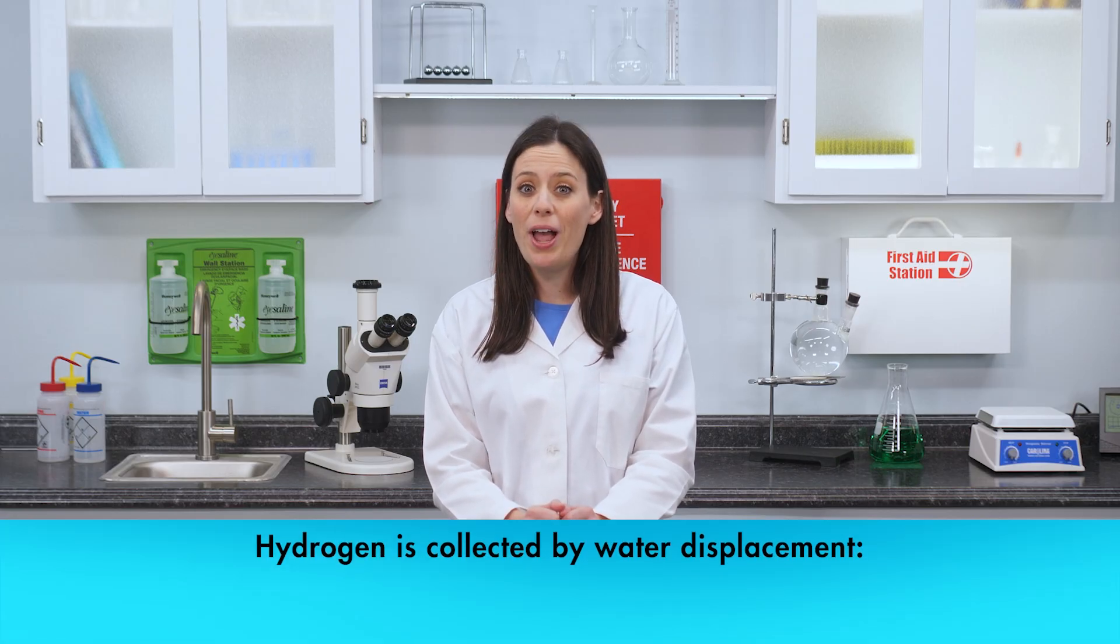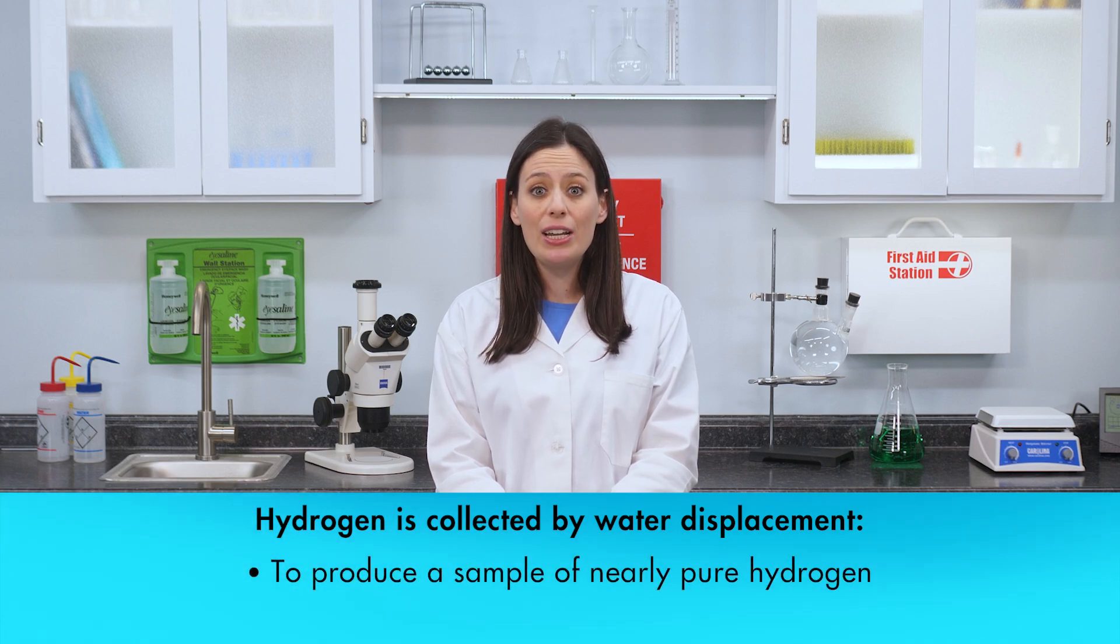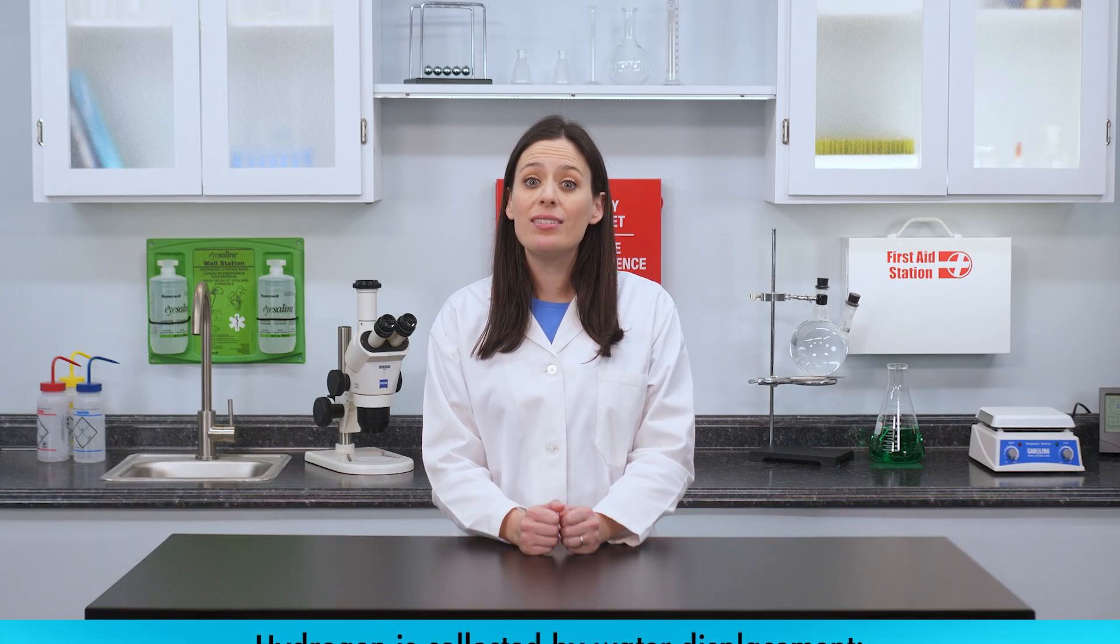Why do you think we use water displacement to isolate hydrogen? One reason we use water displacement is to produce a nearly pure sample of hydrogen gas so we can investigate its properties. The second reason will be discussed shortly.